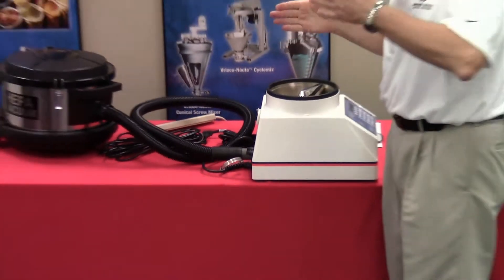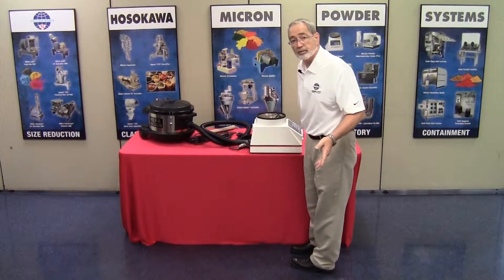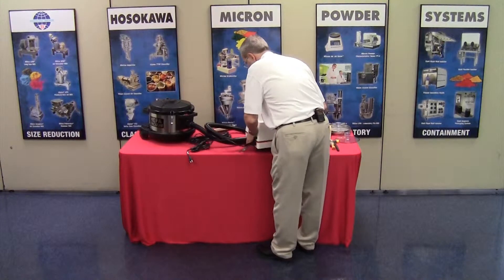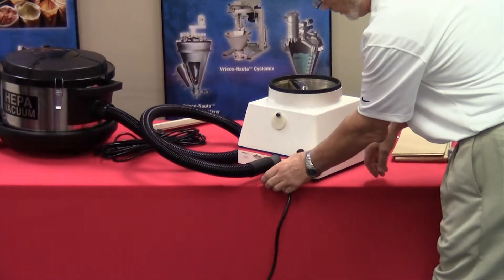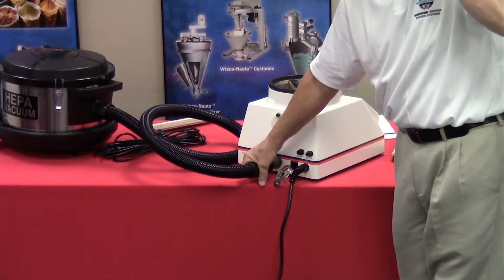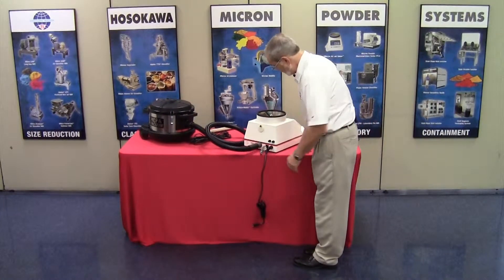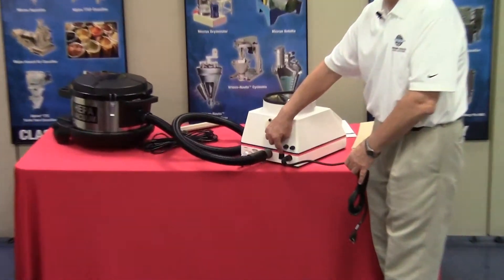Normally speaking, you would not see this end, but because of the video we're trying to make things a little more visible for your operation. On the back of the Airjet sieve, you will also notice there is a grounding clamp. That grounding clamp can be connected to your hose — it's basically additional safety should static charge build in the hose. This will help ground it out. Not always necessary because it is an anti-static hose.